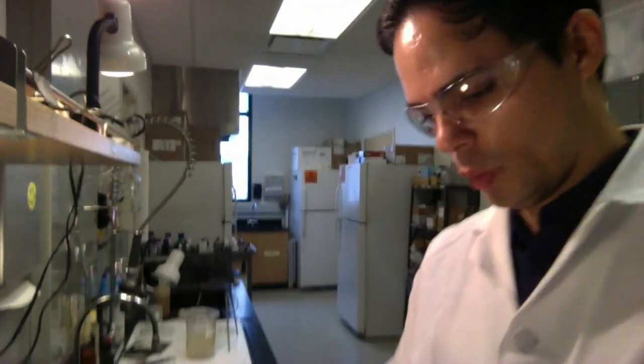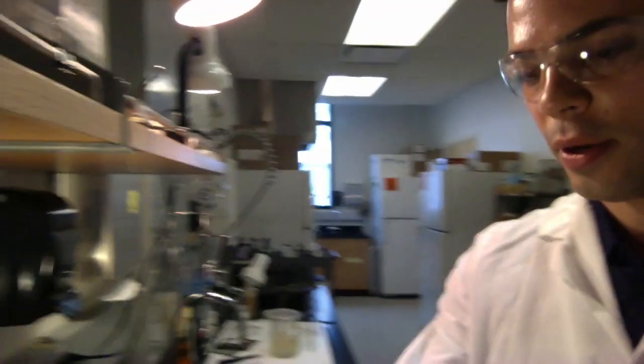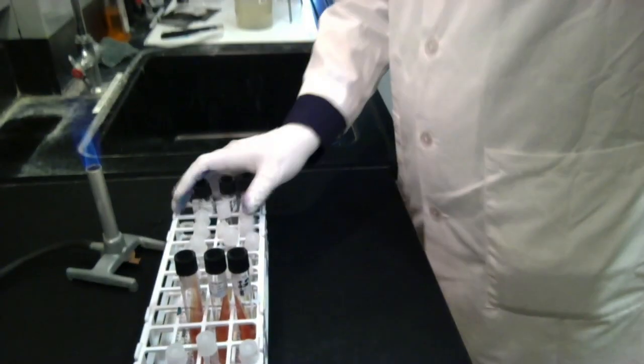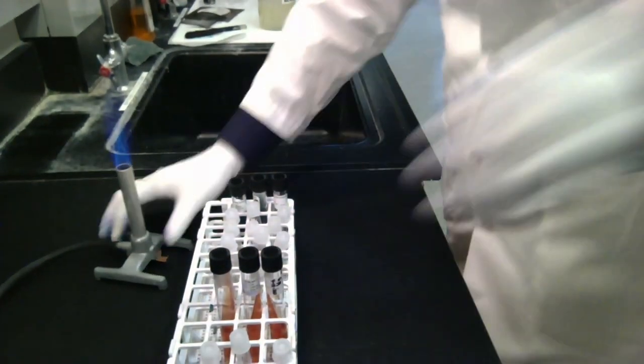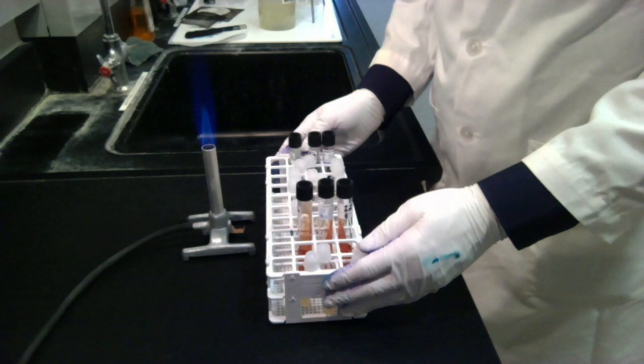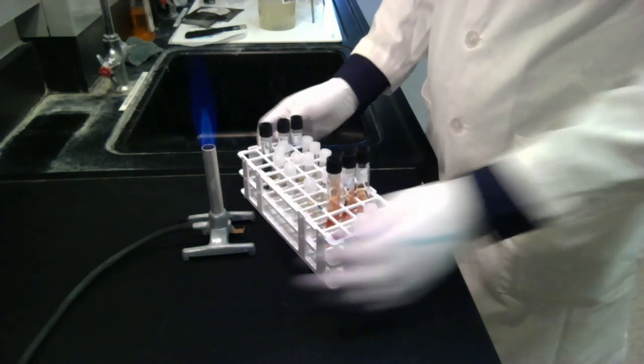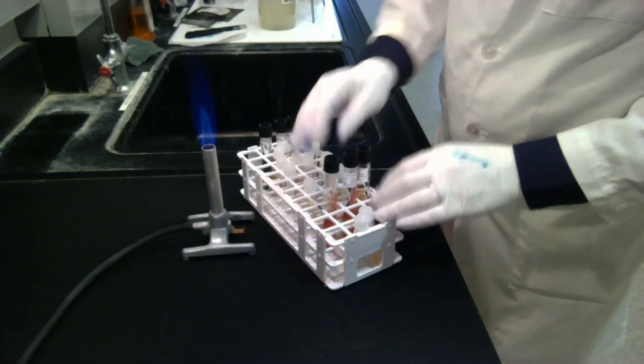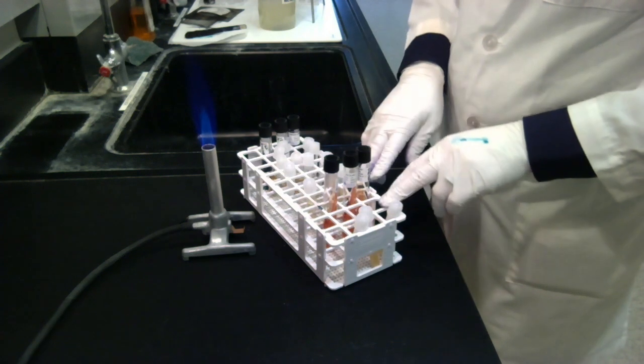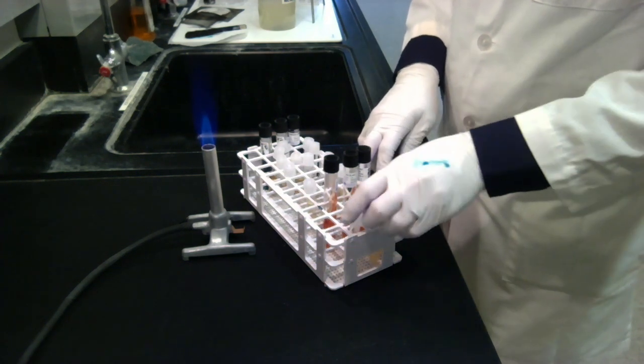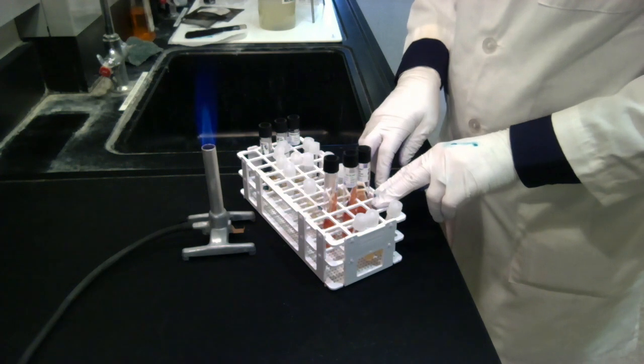Okay, so we're going to be inoculating these three sets. To do that, make sure you are working near the flame at all times, as usual. Here I have my flame.